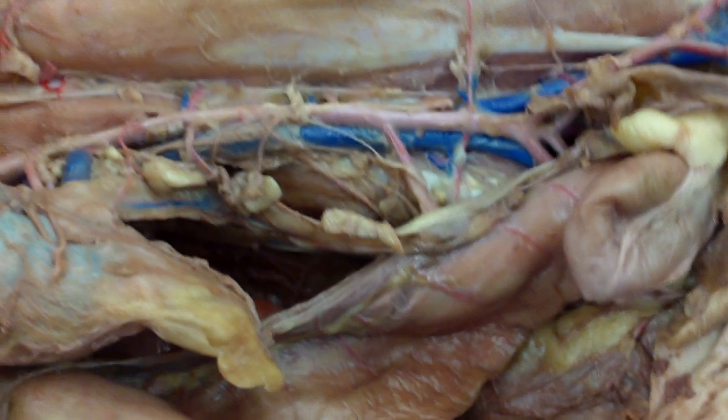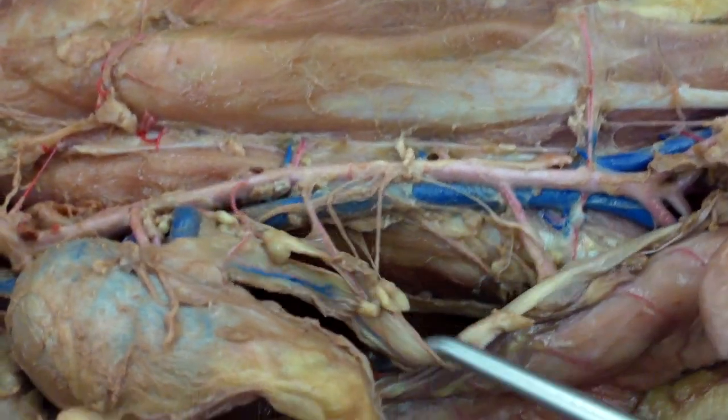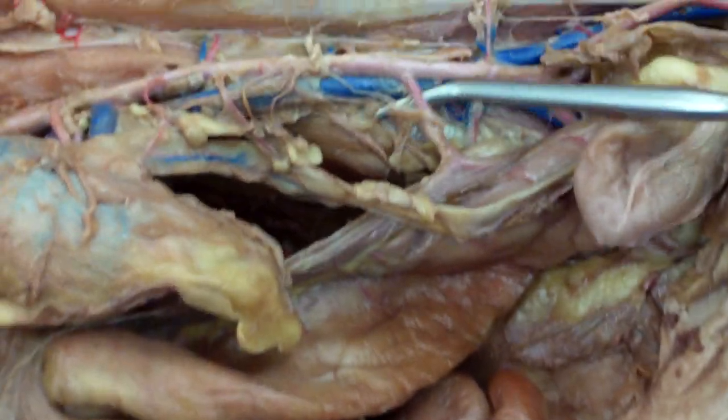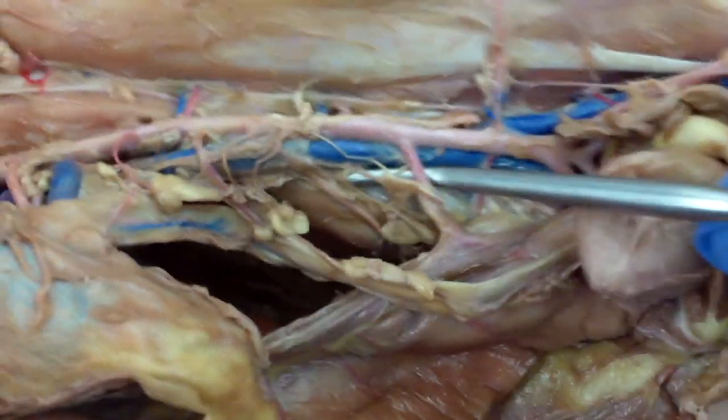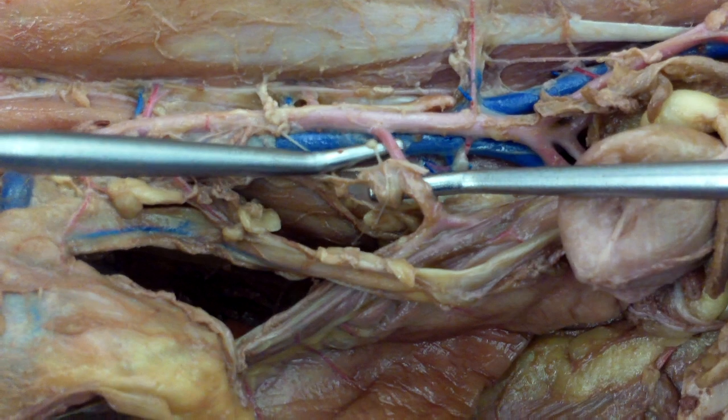Then underneath that, you'll have your inferior mesenteric, which goes to your large intestine. Here's your inferior — right there.